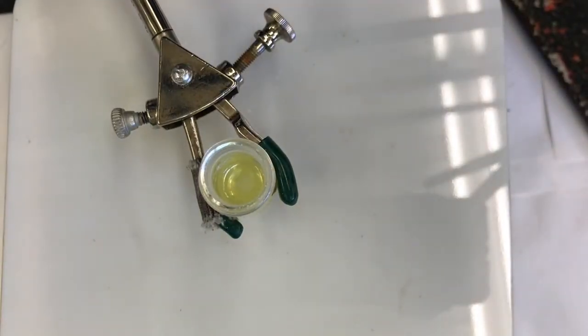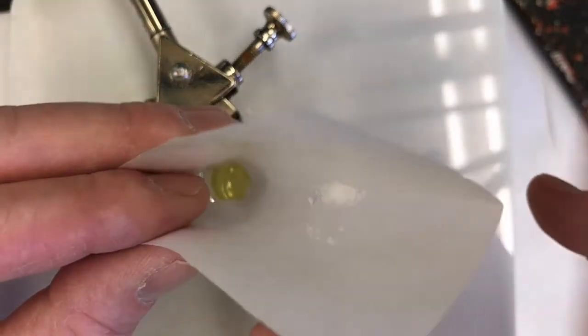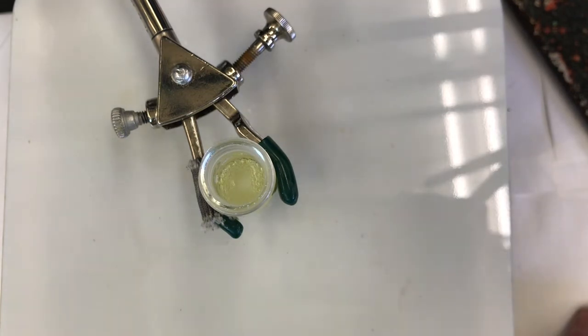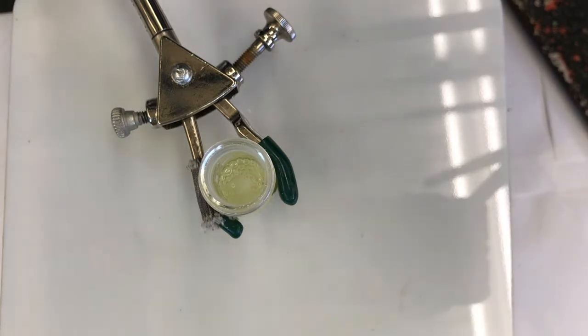Okay, I'm going to add more sodium borohydride. This is at about almost 10 minutes in. I'll tell you the time when I actually get it in there. So boom. It's in at 9 minutes 56 seconds. So at 9 minutes 56 seconds, added 17-ish milligrams more sodium borohydride. Okay. So I'm going to give that a little time to react, and then I will spot that on the TLC plate too. I'll do it at like 11 minutes and 12 minutes, say. Let's see if that works.